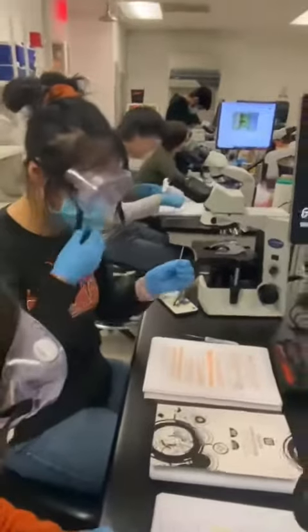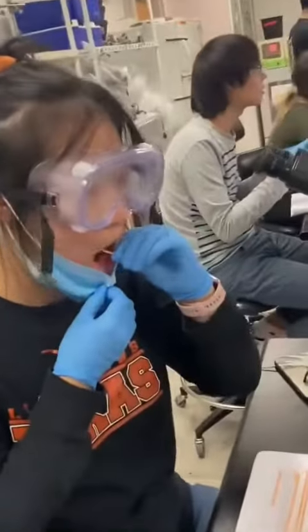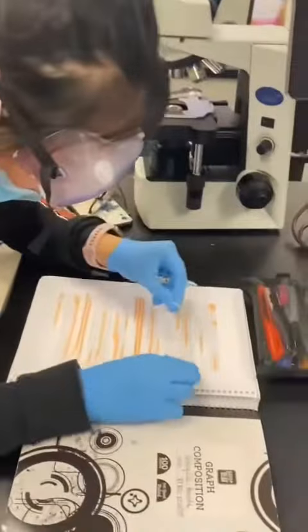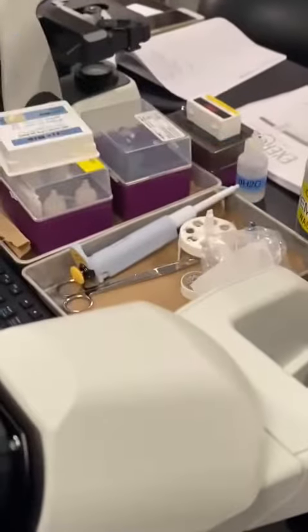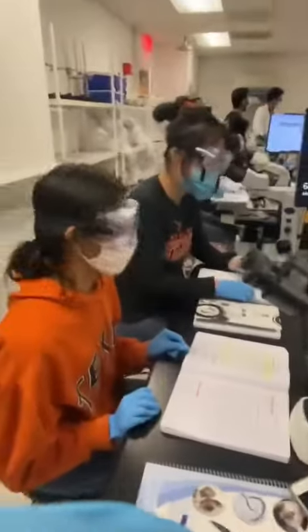She's currently opening the sterile toothpick. She's going to bring her mouth down. And then this goes to the biohazard — she puts it in the biohazard waste. And that's all from us.